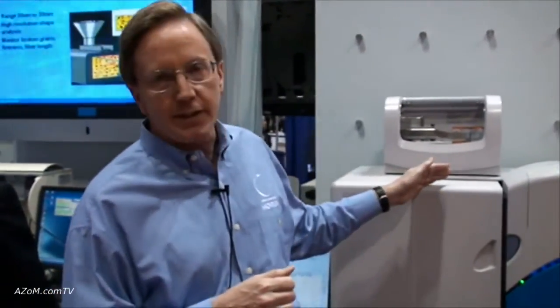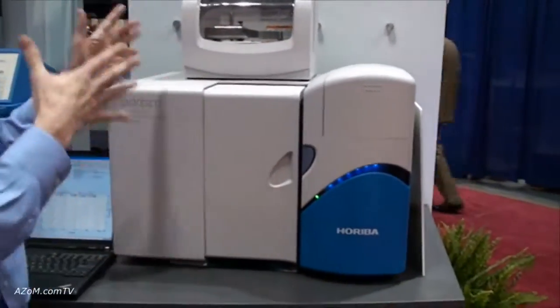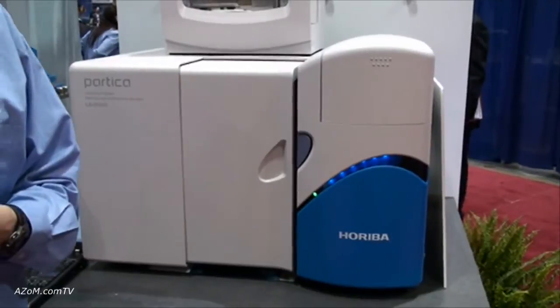What I'm going to show you here is the LA950 laser diffraction analyzer, and we're going to go through why it's a bit unique and how people can use it to measure a broad range of particles.